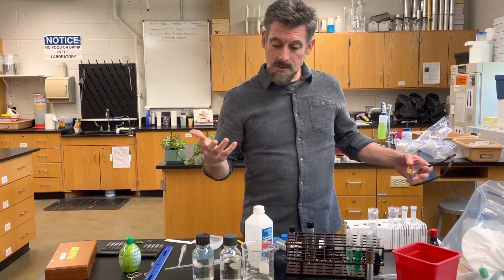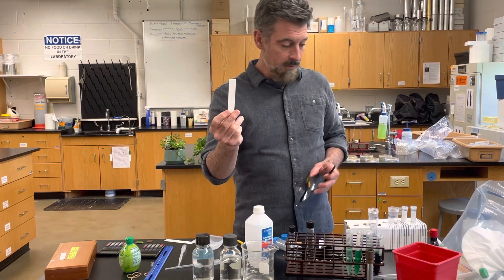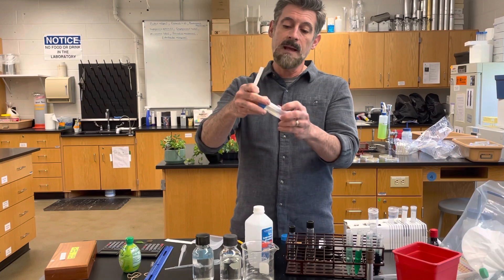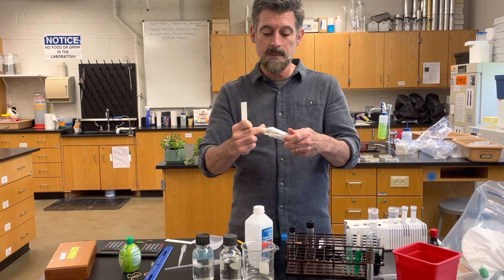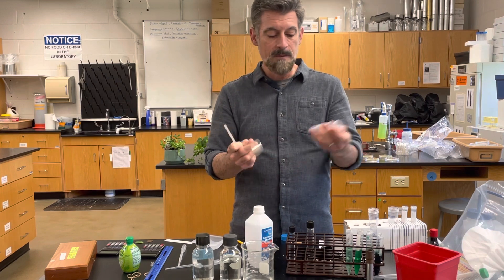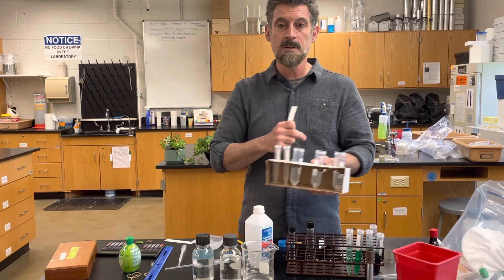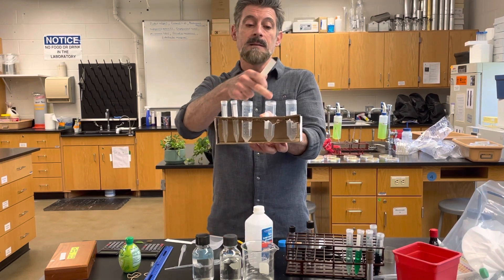To do that we need a few things, most of which are included in your kit. You're going to have little pieces of paper called chromatography paper, and you're going to have a number of these larger centrifuge tubes. One of them is going to have your dialysis tubing in it, which you may have already used if you did the osmosis labs. Make sure you take all the dialysis tubing out so you have an empty tube. You may also have to modify your test tube holder to hold these larger test tubes.